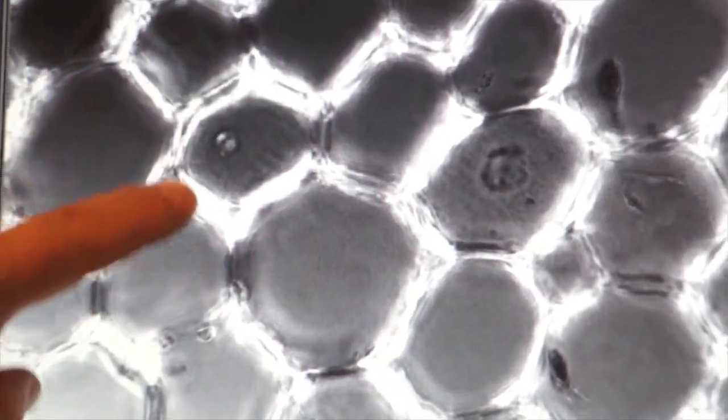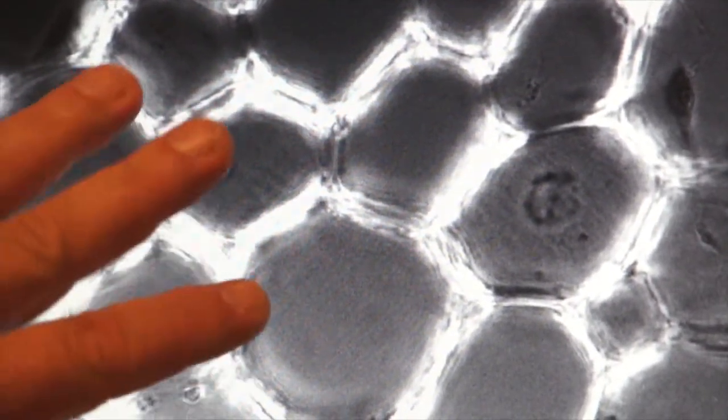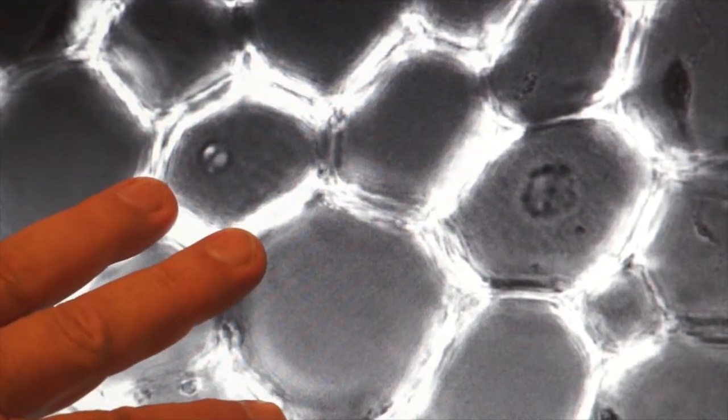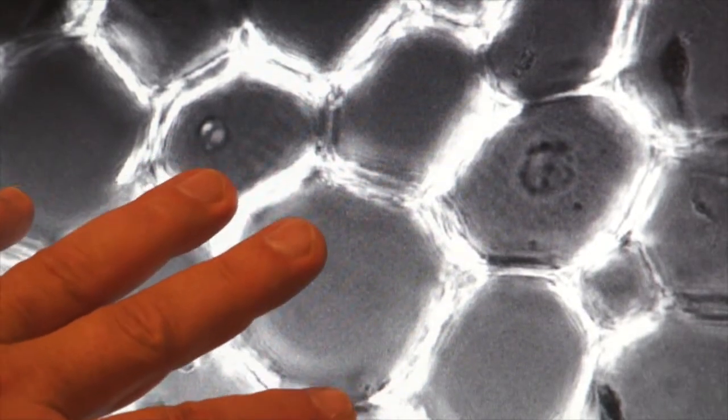However, because of the polarized light nature of the cell walls, all of these glow highly in this slide. But if you're growing live cells on cover slips or in a culture plate, sometimes Nomarski is a better way of imaging those cells in a transmitted light method.